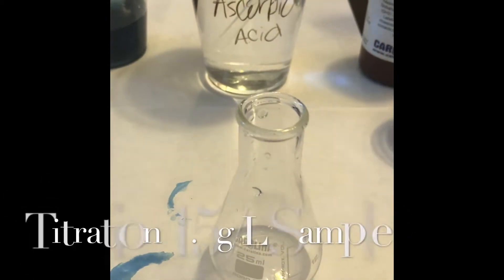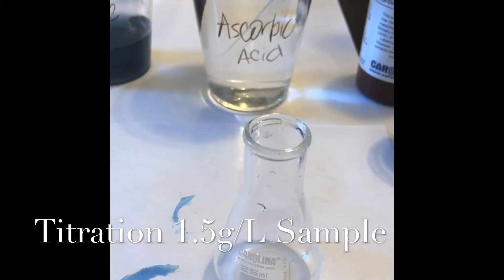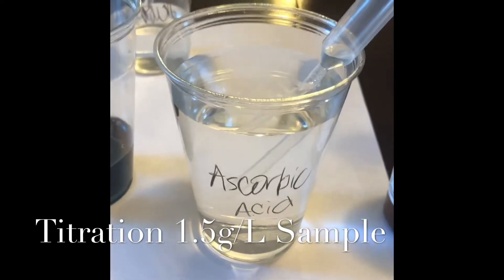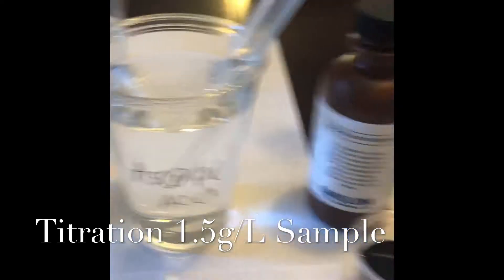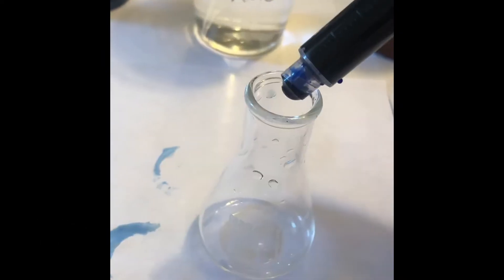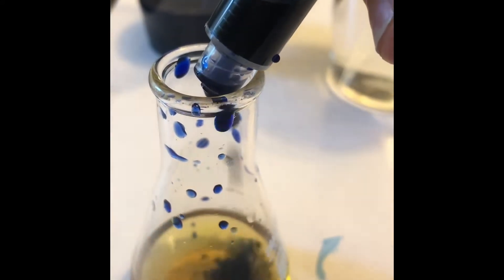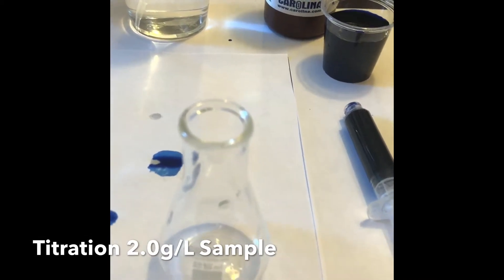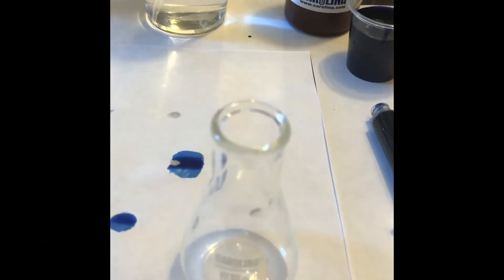Next, perform the titration for the 1.5 grams per liter ascorbic acid sample. We're going to put 1.5 ml of ascorbic acid stock solution and then 0.5 ml of pure water into the Erlenmeyer flask and do the same thing we've done for the last two — looking for the blue color but recording the persistent green color. Then we use 2.0 grams per liter of ascorbic acid and no additional water and do the same thing.